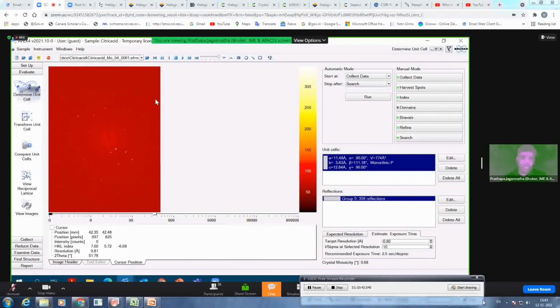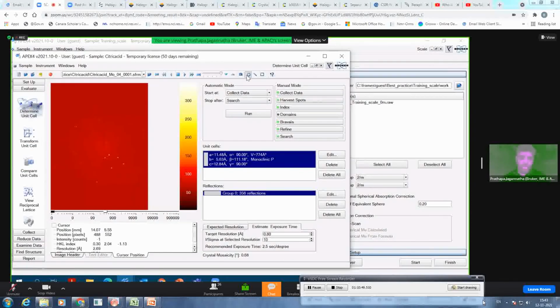And before that, if you want to see the resolution, Carsten has shown you where to see the resolution. You can just use this circle and put it on your screen, and you can find out what the resolution of your data is, because I want to integrate the data only up to the resolution I have. I do not want to integrate the empty regions, which just lead to poor completeness.